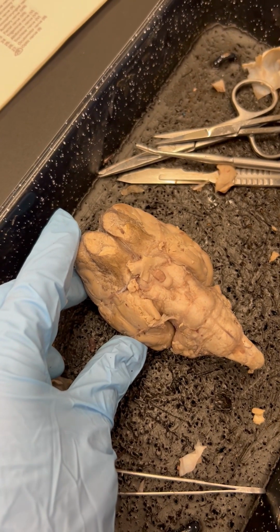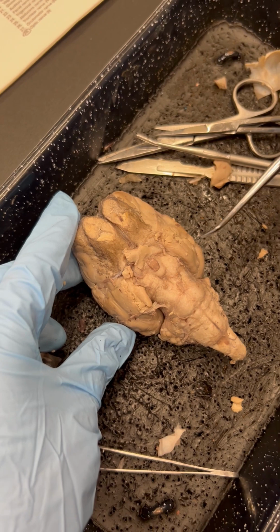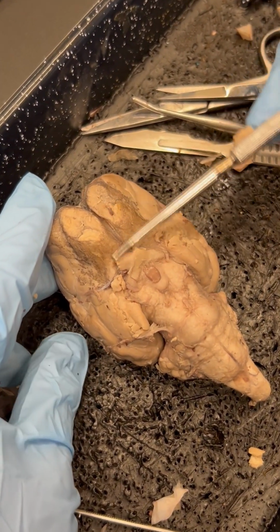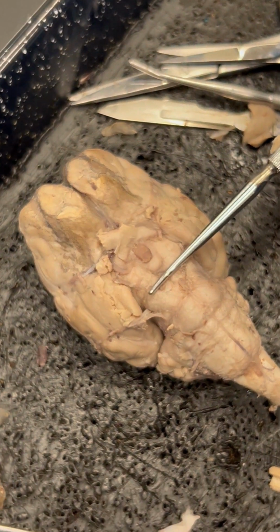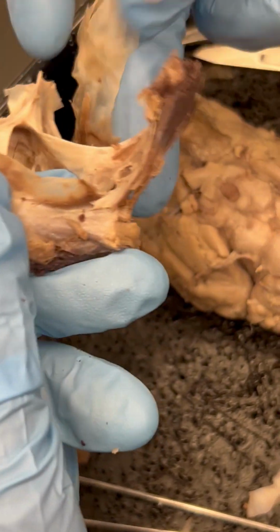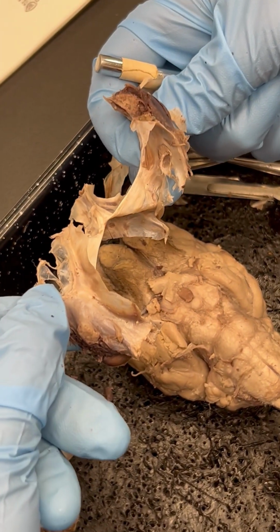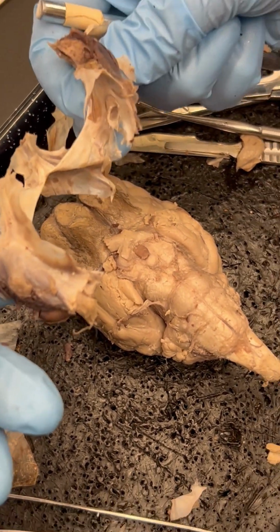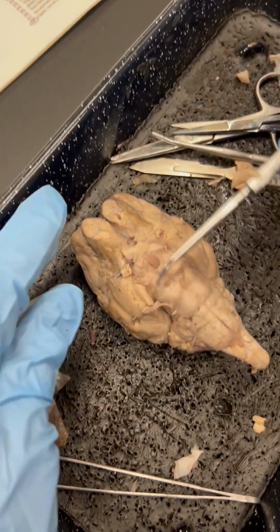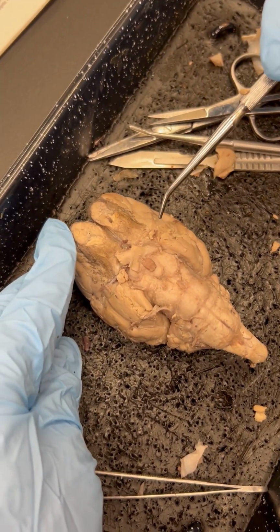In this video, we are going to discuss figure 10.11. To get better visualization of the underside of the brain, I was able to remove all of the dura mater. I made a cut in the center of the dura mater, which then opened up and released all of those more difficult regions. You are going to want to remove all of the dura mater to be able to see the underside of the brain the best.